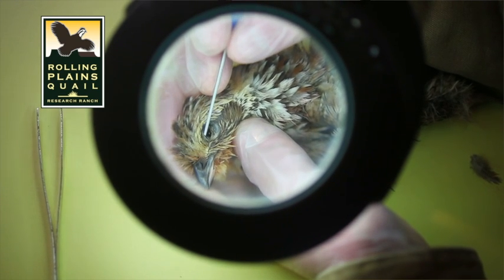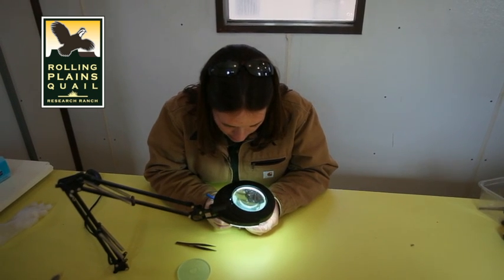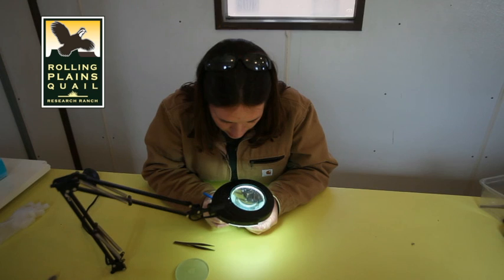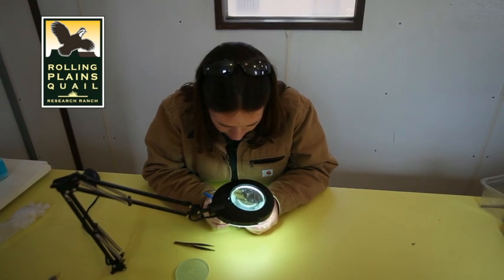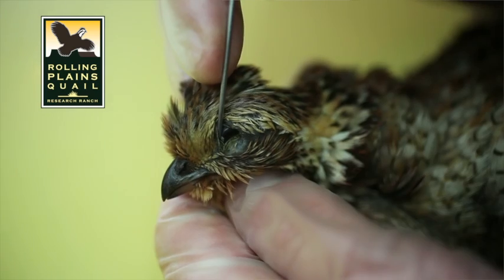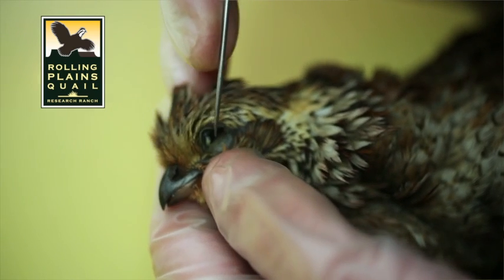If you don't find any there, next you find the nictating membrane, which is located towards the front of the eye, closest to the beak. It's the third translucent eyelid that quail have. If you can gently stick the probe underneath it and lift up, that's the most likely place to find an eye worm.